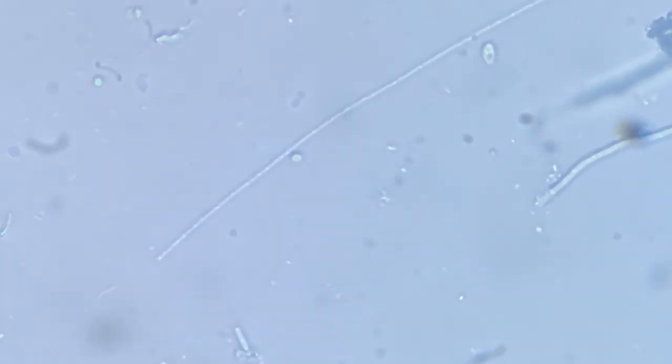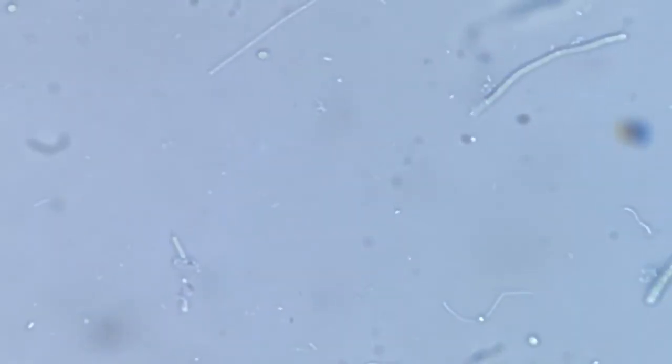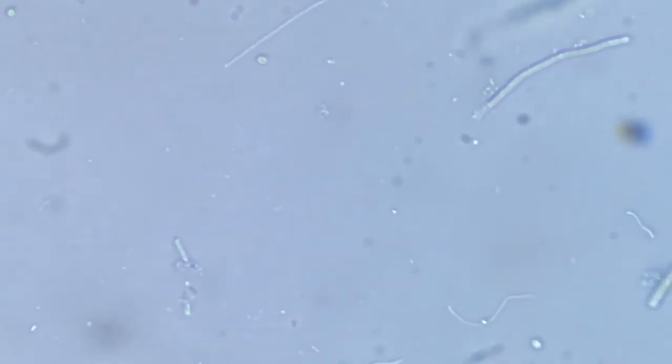There are no spines or flagella apparently visible here, no spines, hooks, or any other adhering appendages or outgrowths, either at the head or the anterior tip end or at this back end. And we can just see this bacteria. So you can imagine the size of this organism. There is this bacteria around. Now I'll bring it in the center. It's right in the center. So you can make an idea of how long this is.